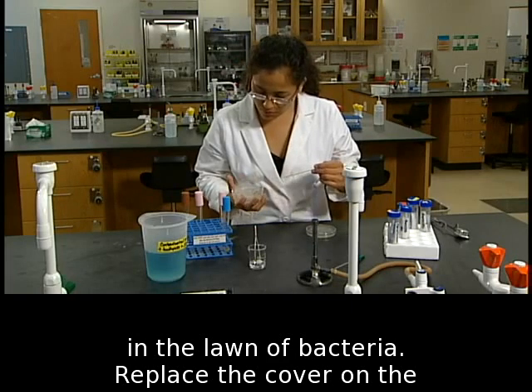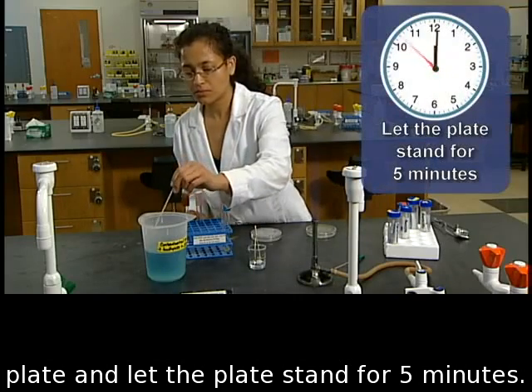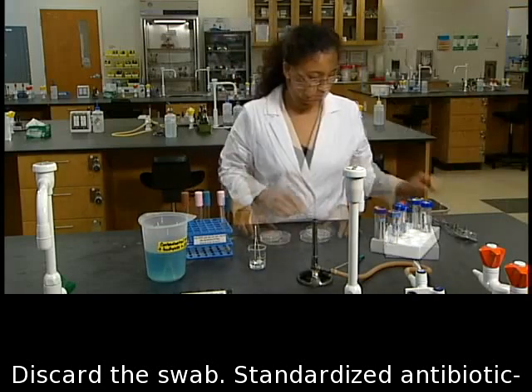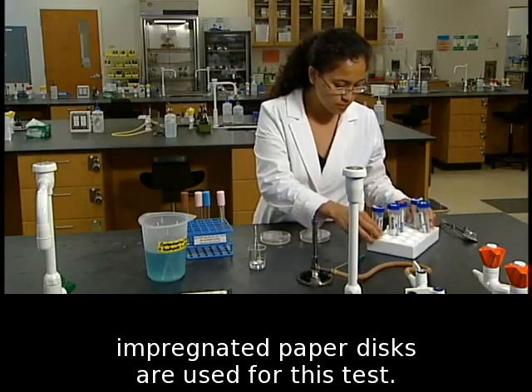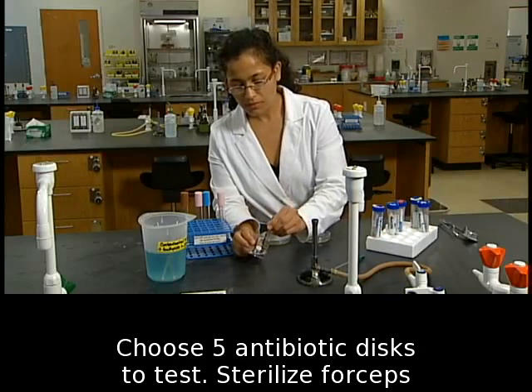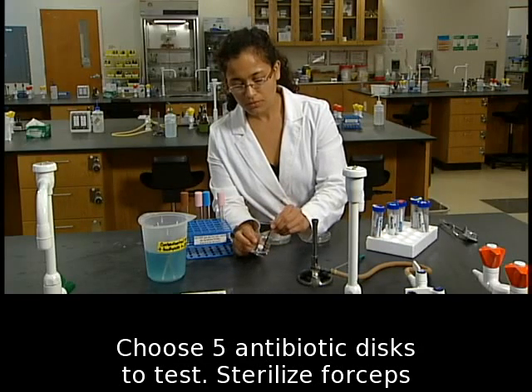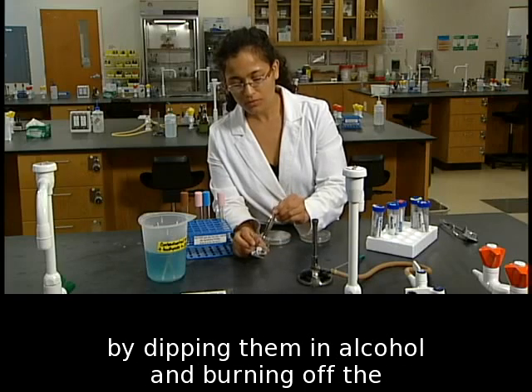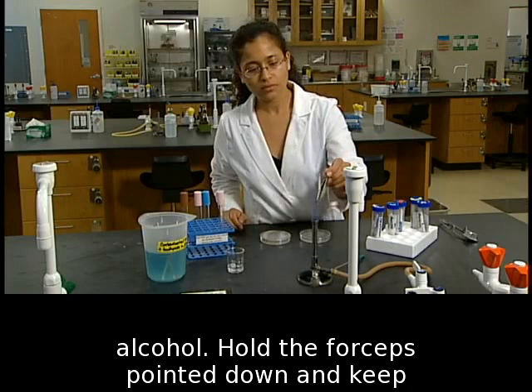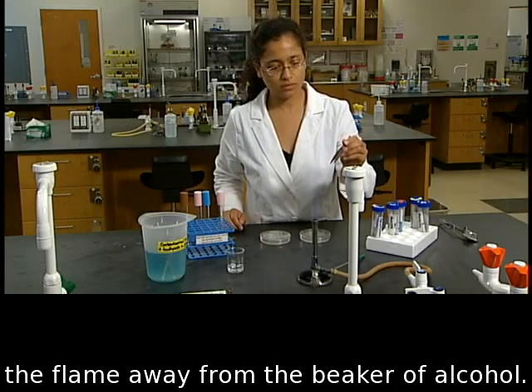Replace the cover on the plate and let the plate stand for five minutes. Discard the swab. Standardized antibiotic impregnated paper discs are used for this test. Choose five antibiotic discs to test. Sterilize forceps by dipping them in alcohol and burning off the alcohol. Hold the forceps pointed down and keep the flame away from the beaker of alcohol.